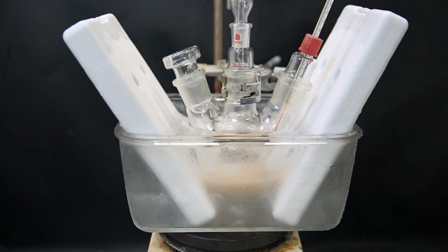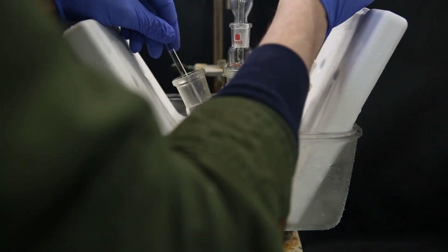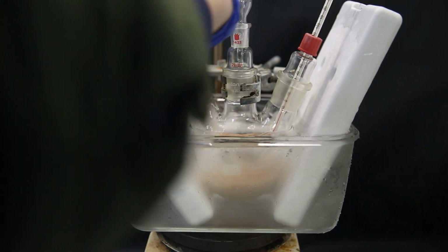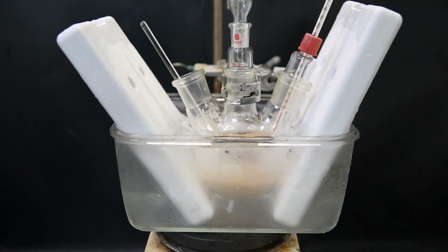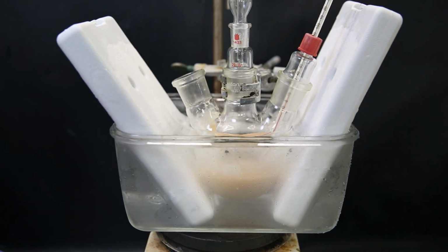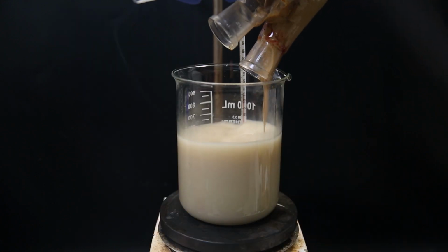constantly. Also, midway during the addition, the stirring stopped, because a lot of solid had formed, which made it annoyingly difficult to distribute the heat properly. I tried to loosen it with a glass rod, and diluted the mixture with more sulfuric acid to get it to stir again, but still it stayed quite slow, and the reaction produced more tar, because it was mixing so poorly. When it was done, I poured it all into some water to dilute it, and then let it cool down.